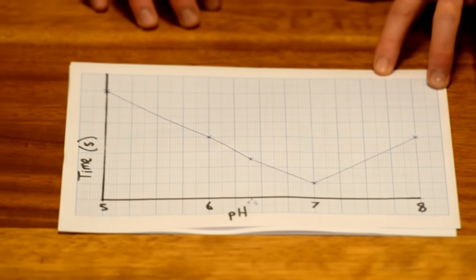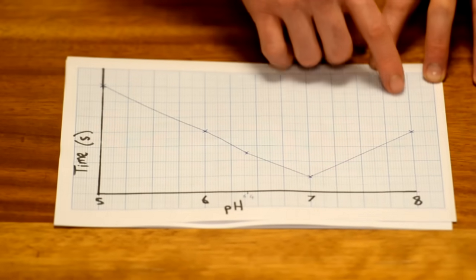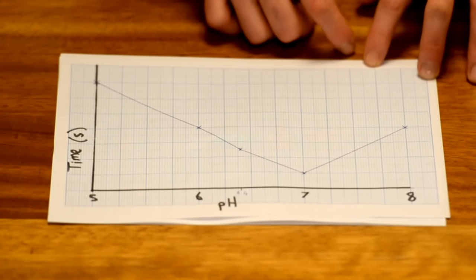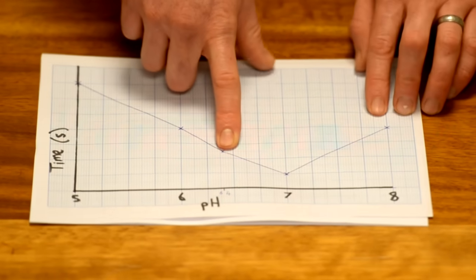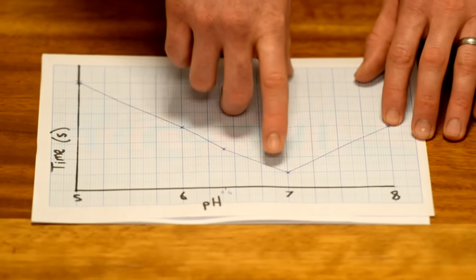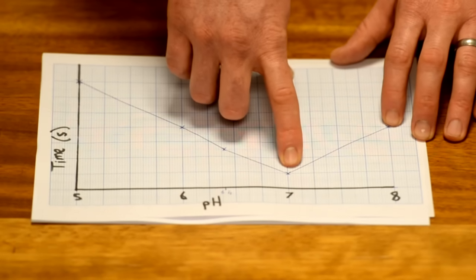Using this range of solutions though doesn't give us a very conclusive result. All we can tell is that the optimum pH occurs somewhere between 6.4 and 8, and that optimum pH may be 7.